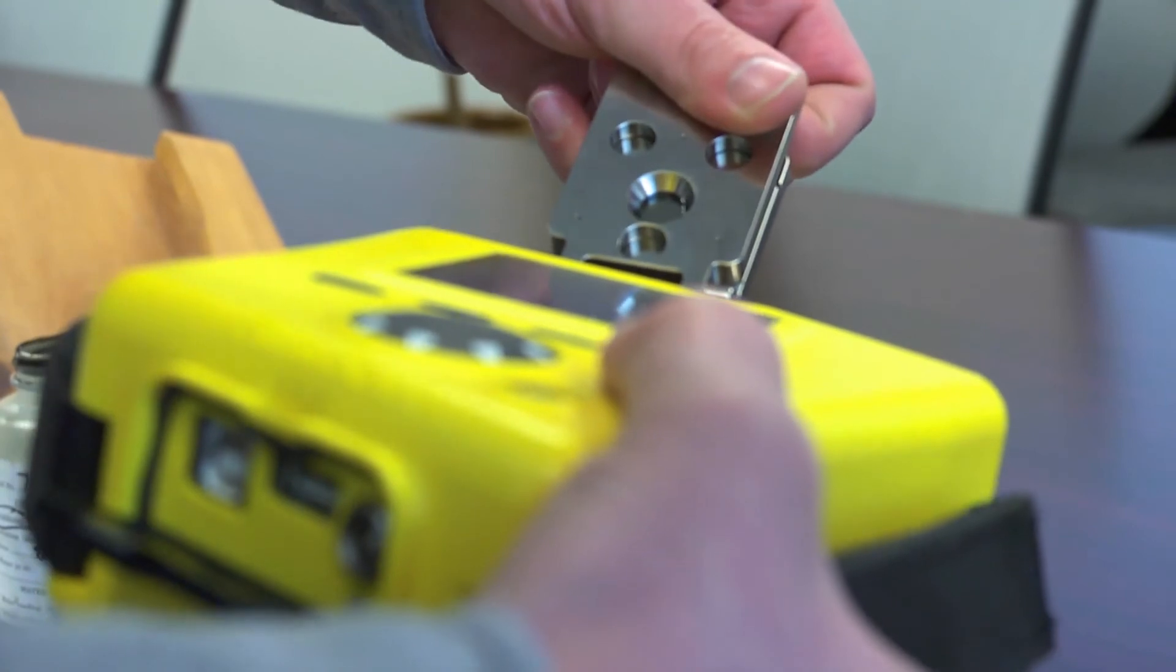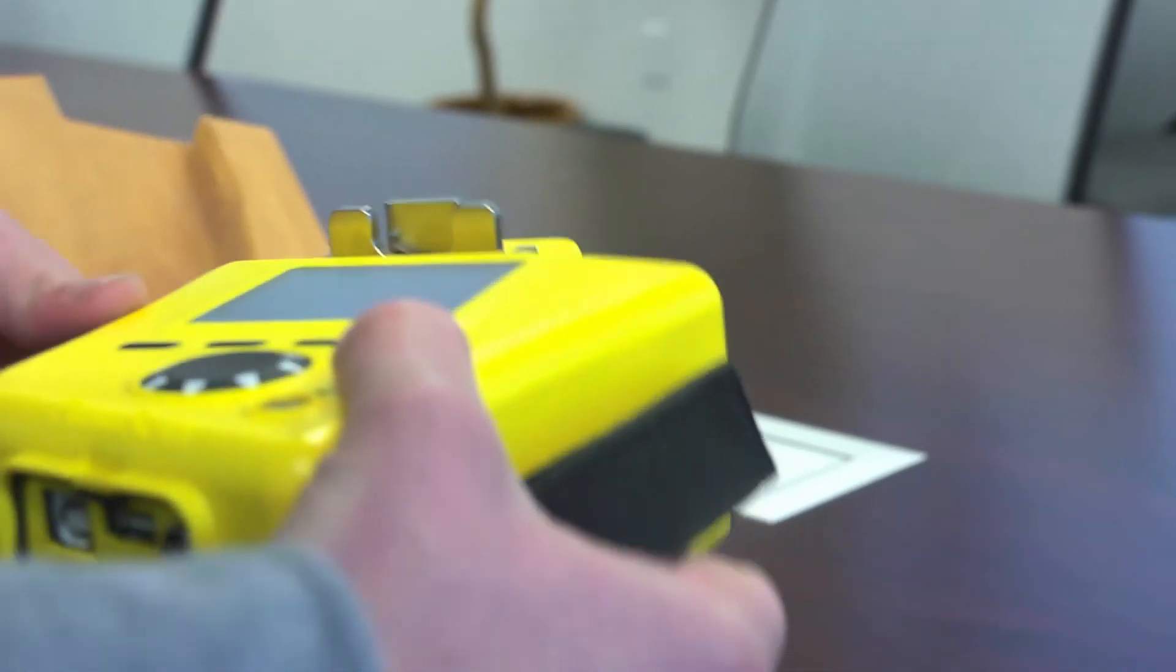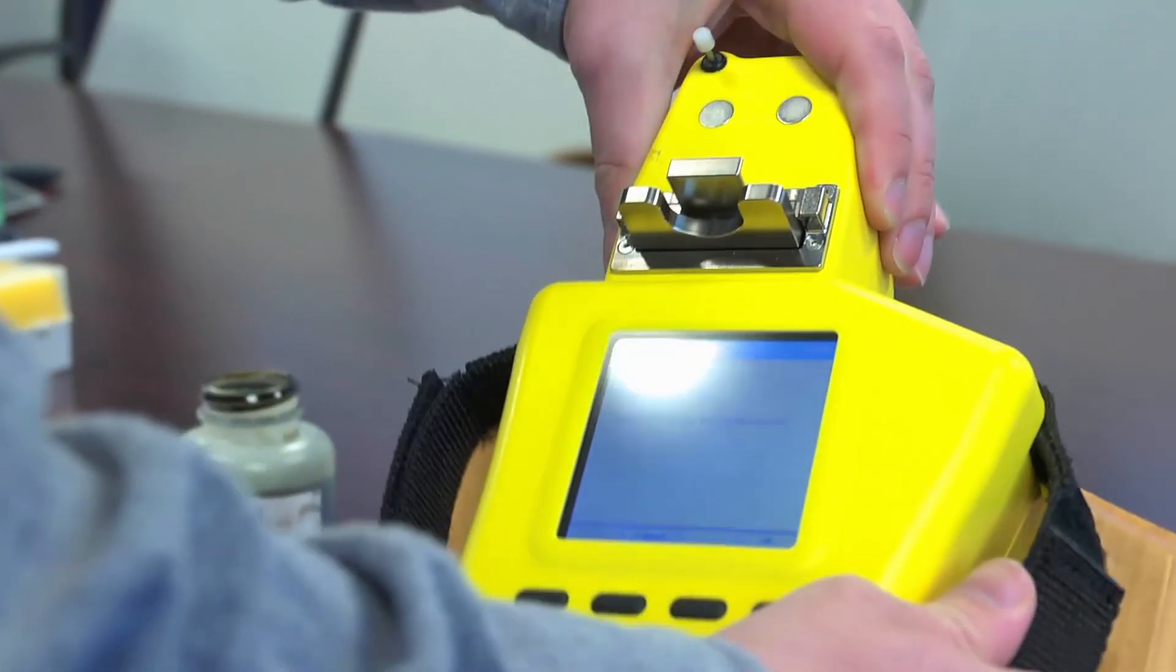We lift that up and check to see if there are any air bubbles in the cell. If they are not visible, we close it and hit OK.